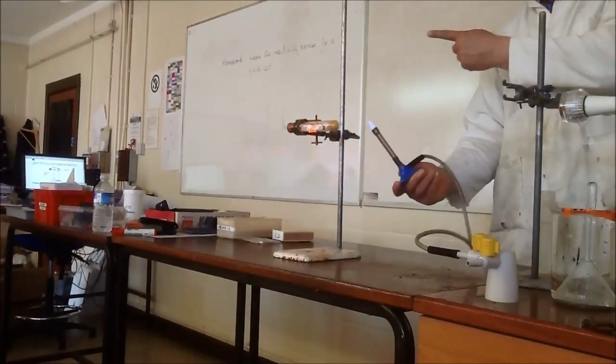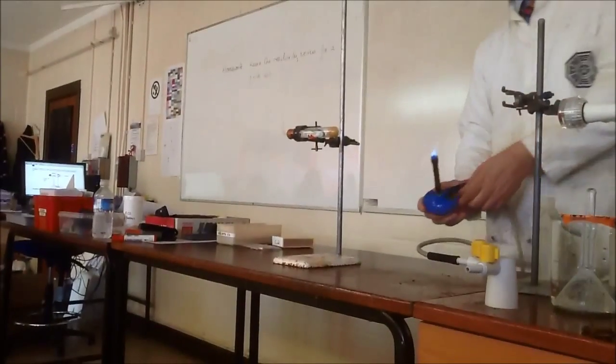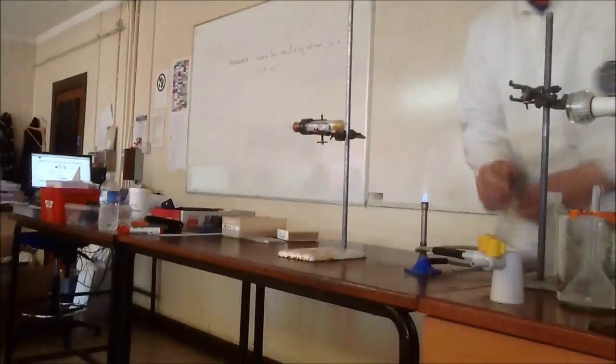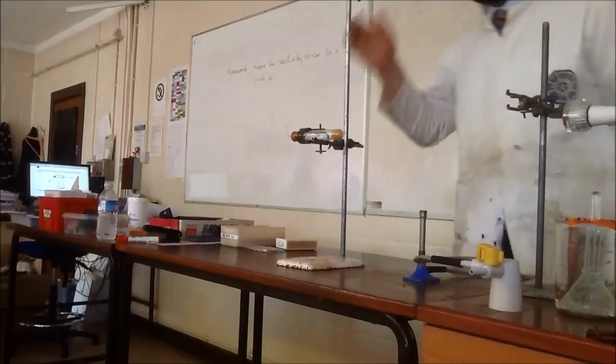Now it's finished because we've run out of steam. It stops, that's just steam. Okay, and the tube's cracked to be expected, and we've got a little bit of magnesium oxide.